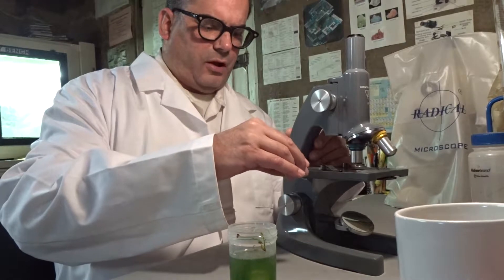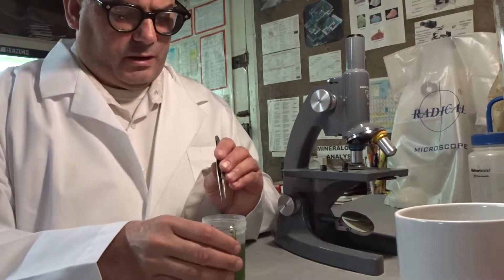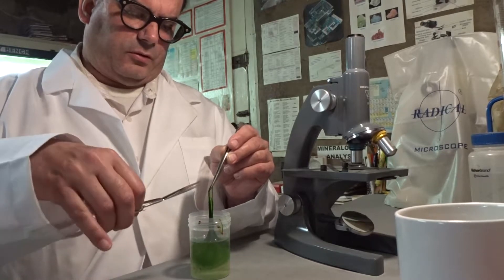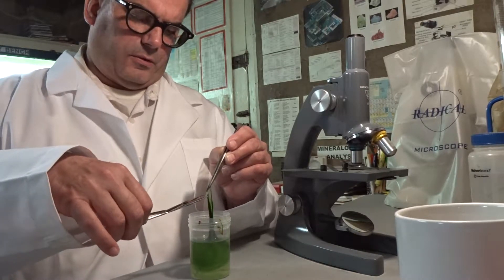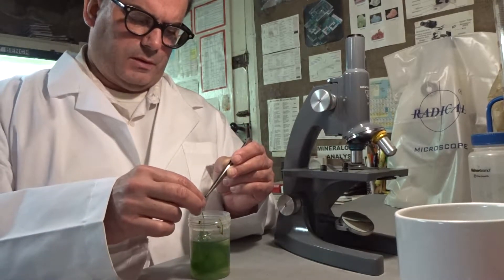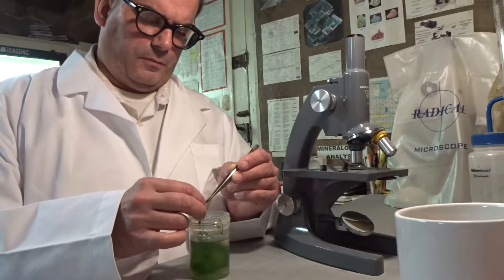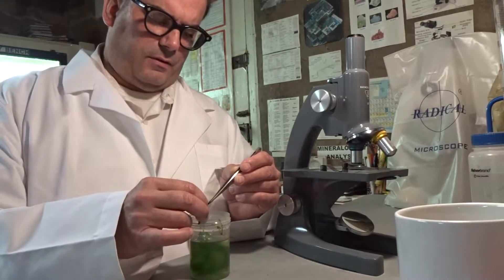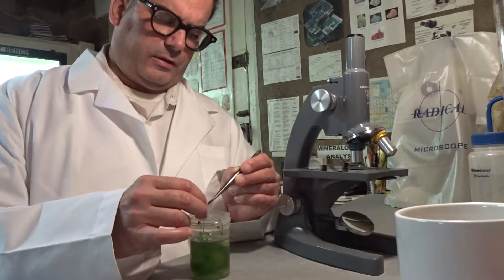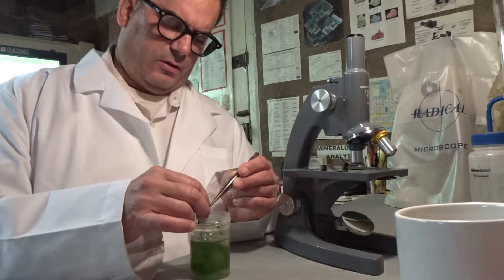On the microscope slide, I'll take some of the sample of the algae that we want to look at. Cut it with a pair of scissors so that it's not too large of a sample. Notice I say sample — in chemistry and biology, we take samples. In geology, we take specimens or rocks.